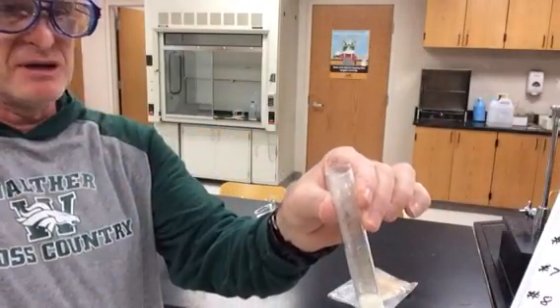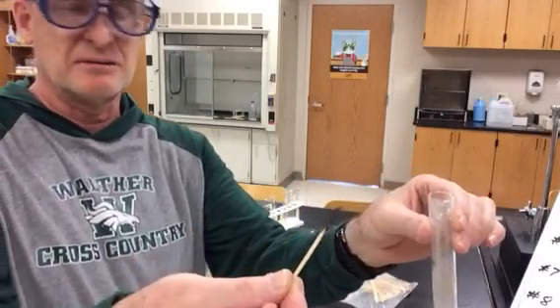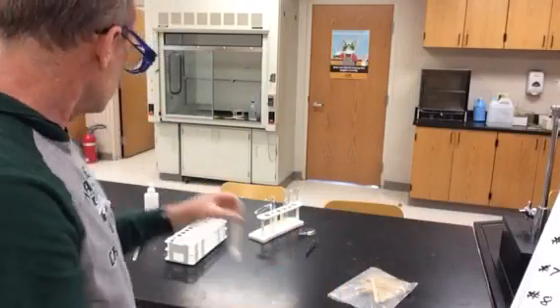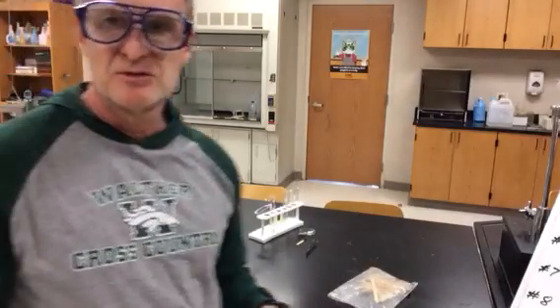Did not make a pop. Matter of fact, it put the gas out, or put the flame out, right? So the gas was kind of extinguishing the flame. So in our reaction page that listed those gases, the test that indicates that flames are put out by a gas is indicative of carbon dioxide.